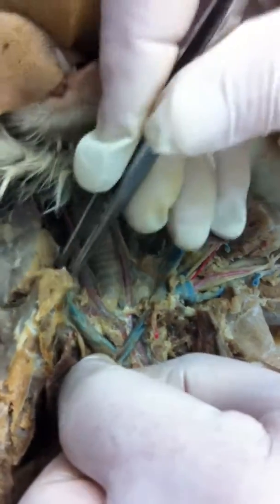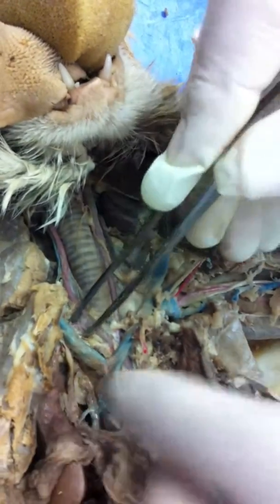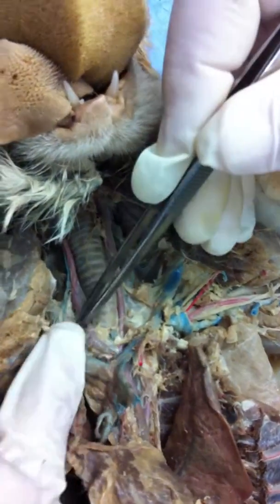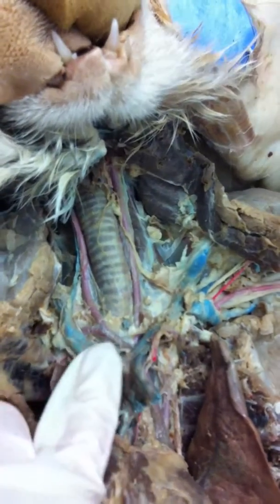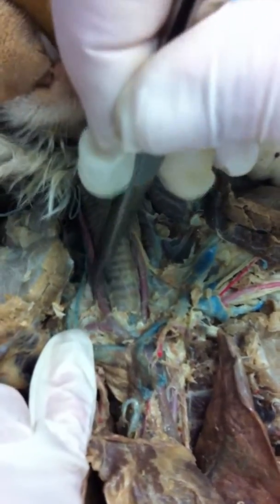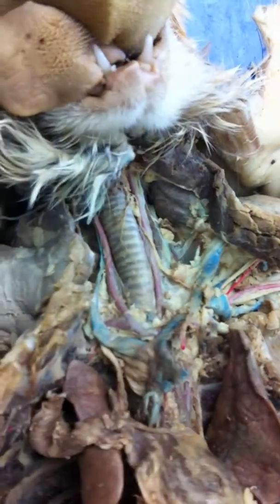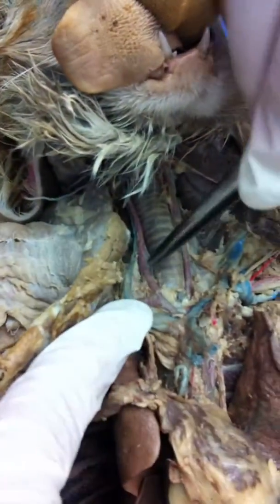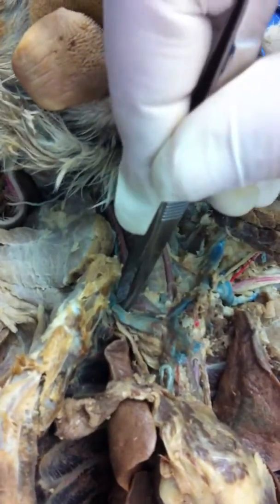See it running right here, right next to the subclavian vein? See this artery right here? Let's see. You see this artery right there, just the top of it right there? All right, this kinda curves around. Common carotid. Right. That is right subclavian. Okay. Can you see that, Laura? Common carotid up here, here's common carotid over here, and then there's the right subclavian.